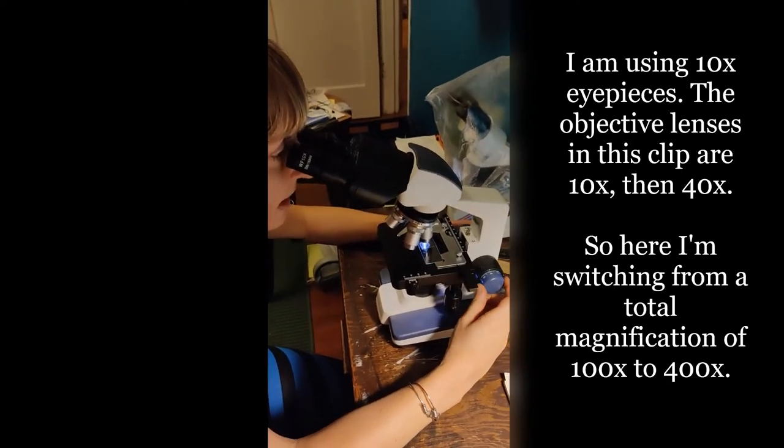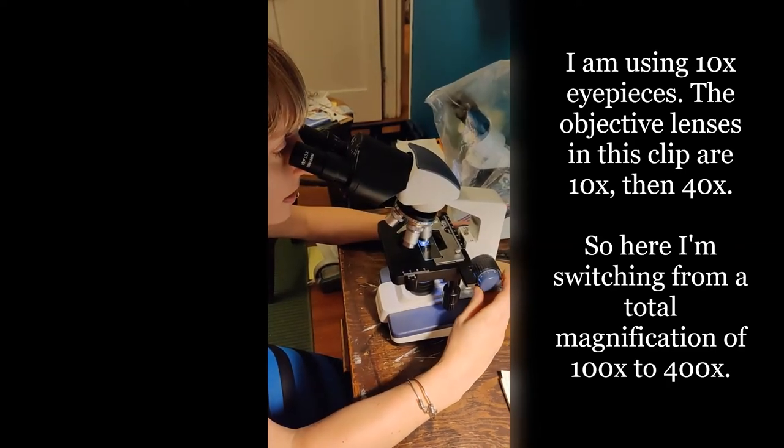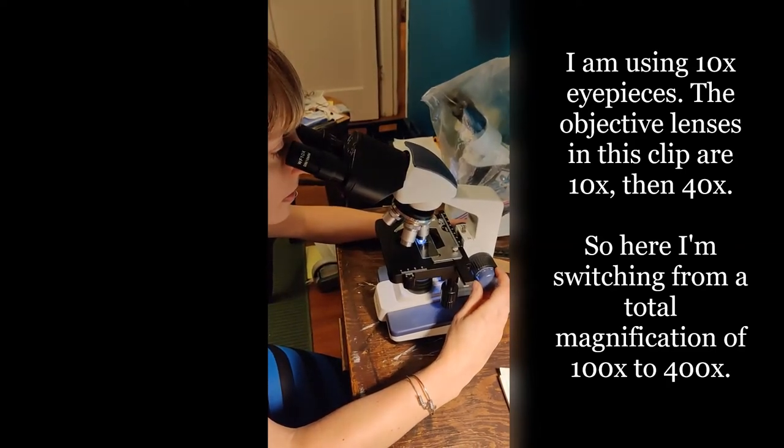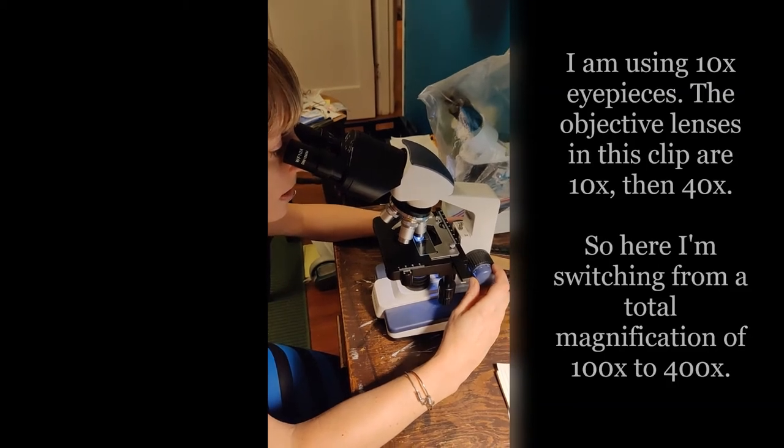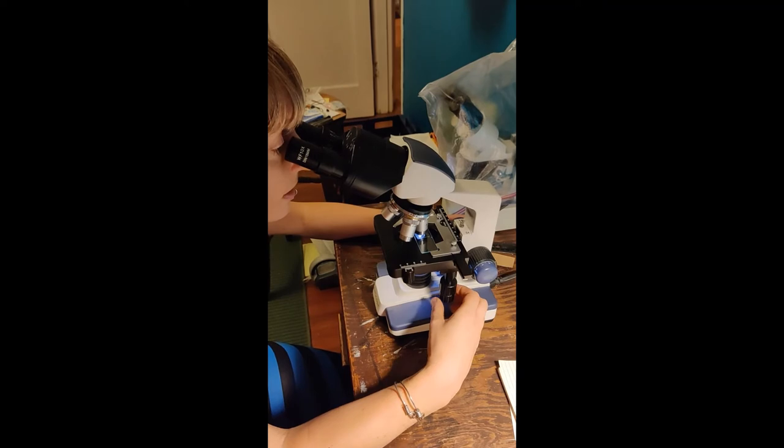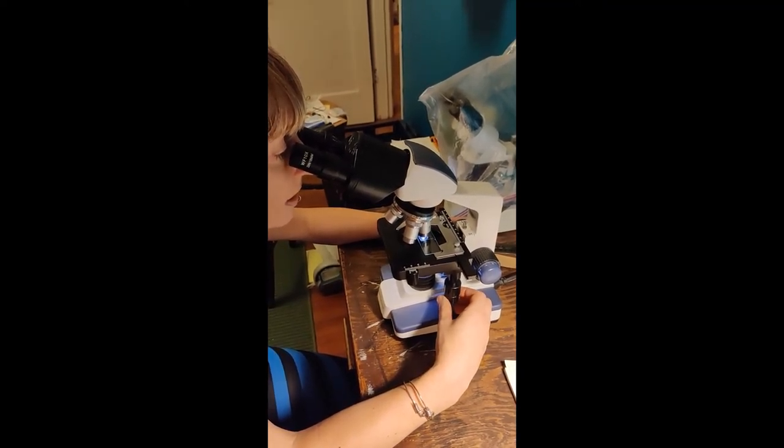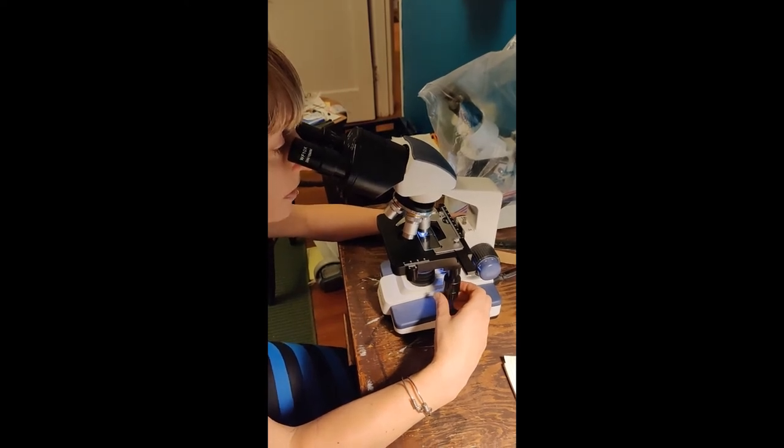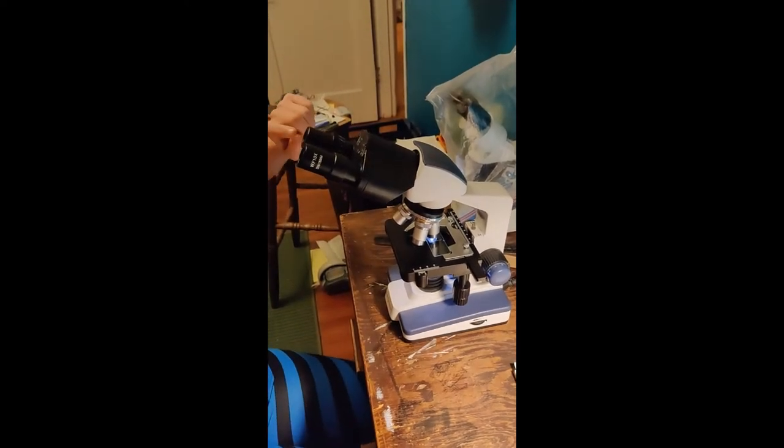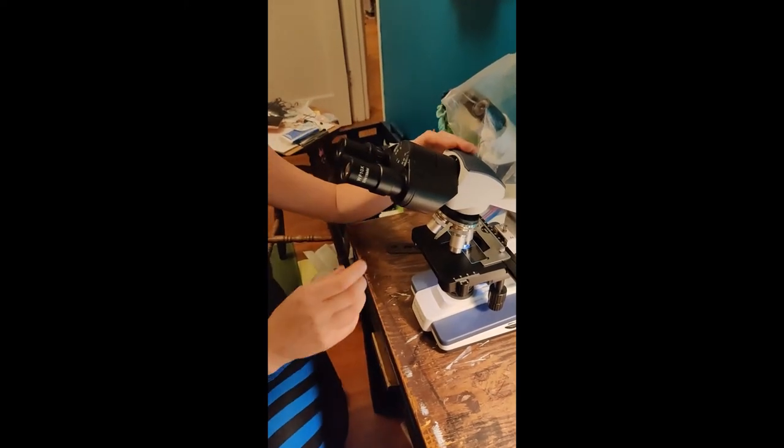All right, and I'm zooming in again with my fine adjustment. That's what I'm doing with my hand here. And now I've got spores. So now I would start measuring spores, and I'm going to have you look through the screen at what I'm looking at here, and you can see their size through this.